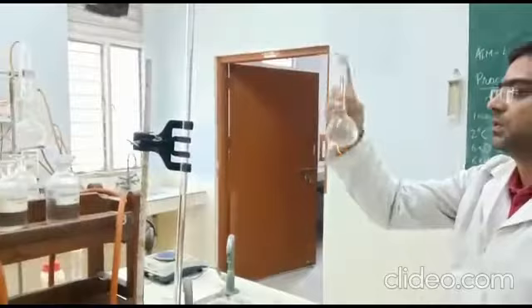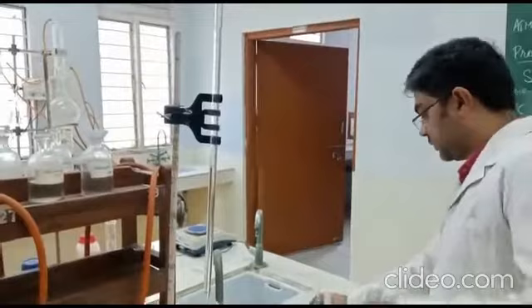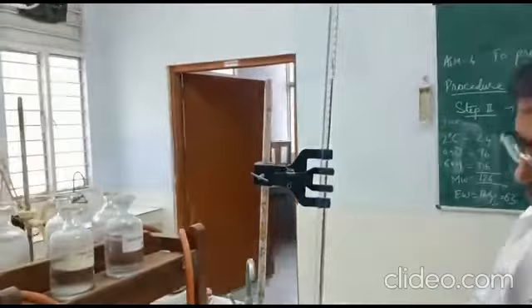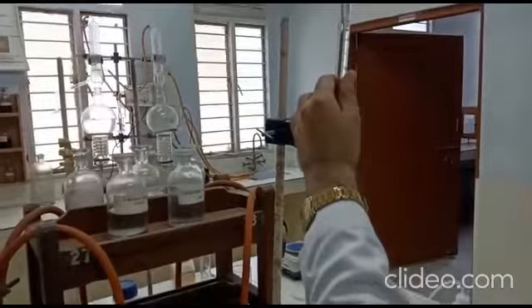Meanwhile, we rinse the burette and fill the 50 ml burette with the sodium hydroxide solution. Excess solution can be drained. The 50 ml burette is now filled with sodium hydroxide, and our oxalic acid solution is ready.